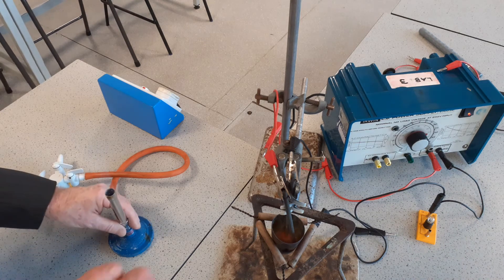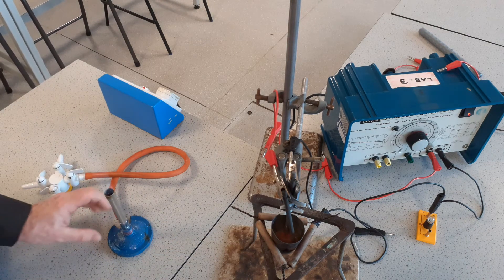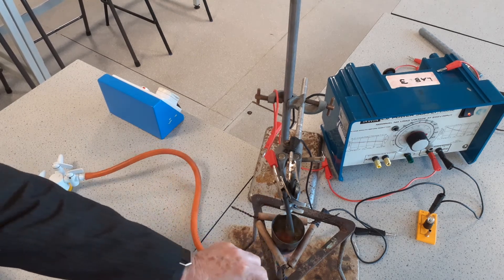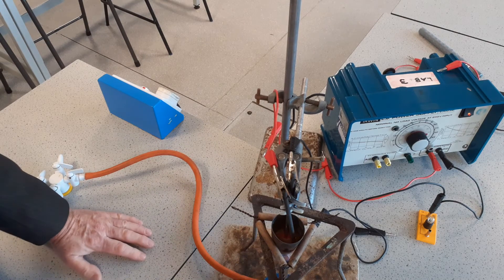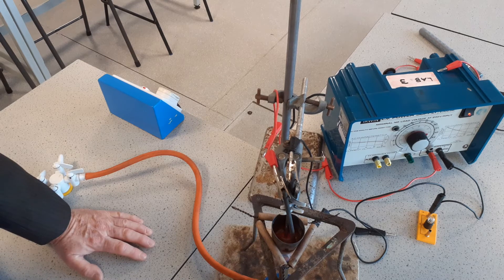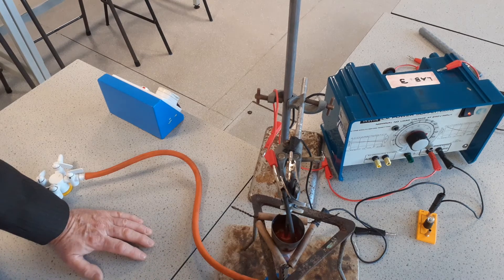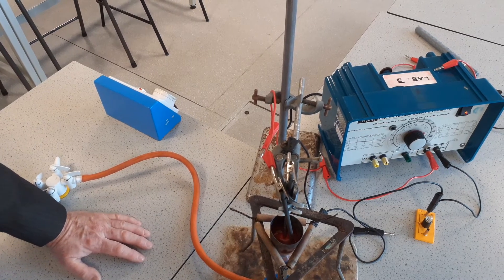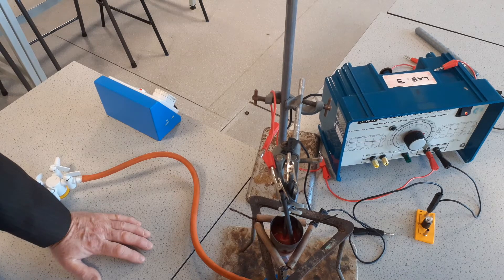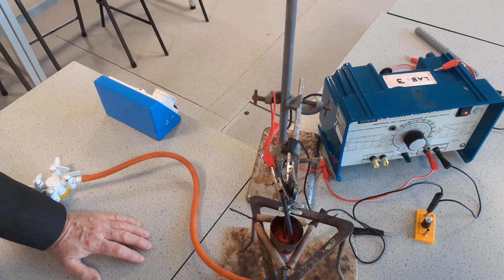As you can see now, we've got yellowy-brown fumes coming off — that's bromine. Now what you will see is that there is bubbling at the positive electrode, and that bubbling at the positive electrode is the bromine being formed. There's no bubbling at the negative electrode because we've got lead being formed there.